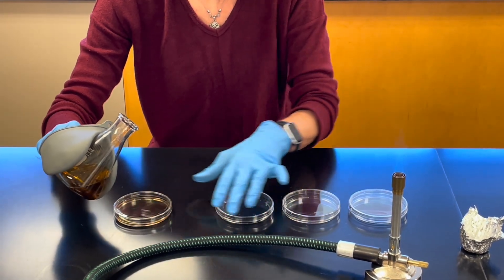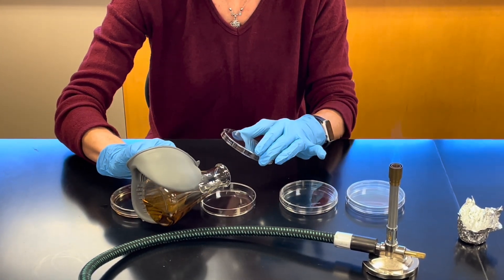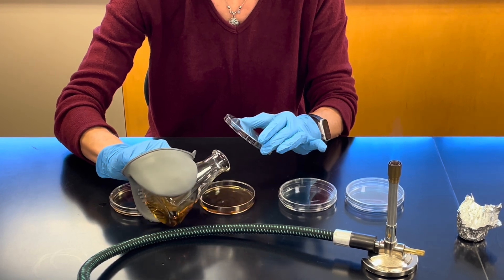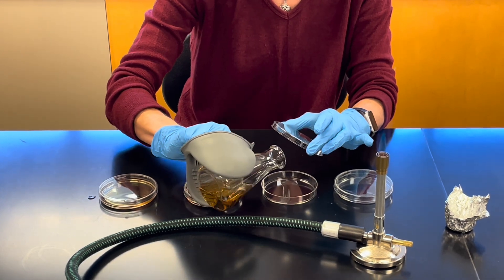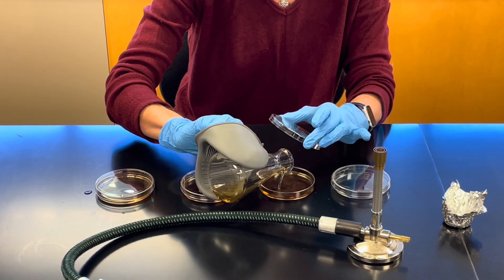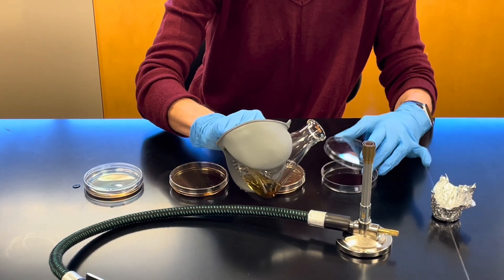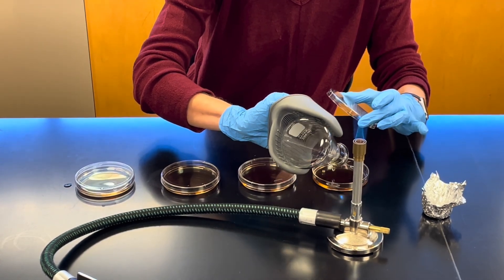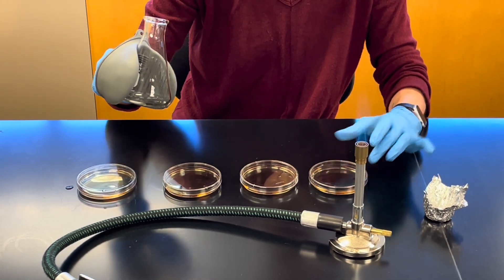Place the cap and move to the next one. Pour using the lid as a shield — cover the bottom, then cover. Lift using the lid as a shield, not putting it on the lab bench. Pour, cover the bottom. For the fourth one, pour, and then you can swirl to make sure it covers the bottom.